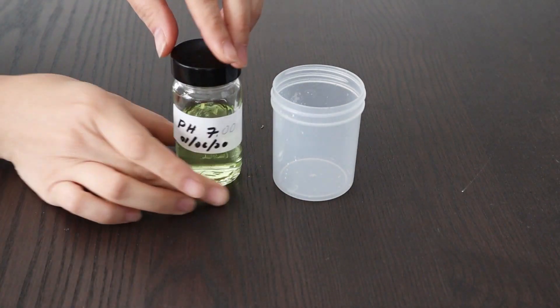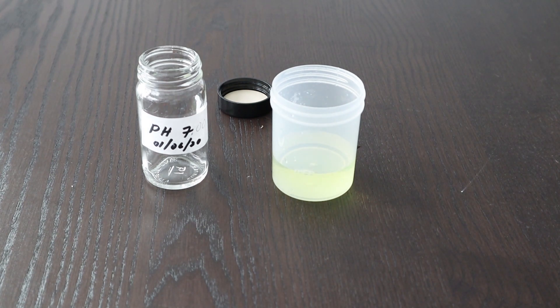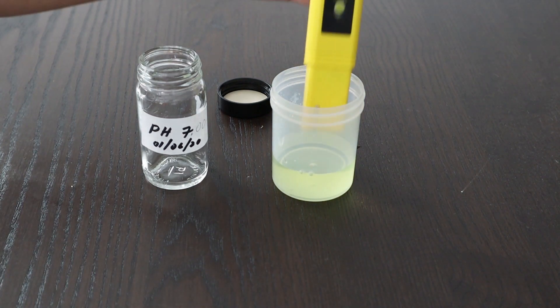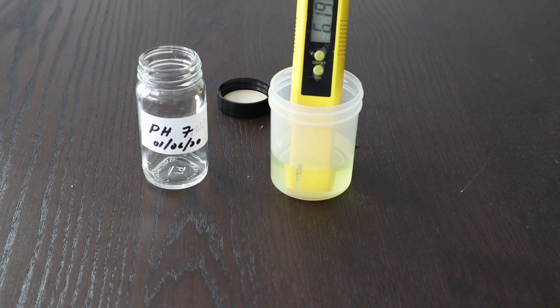To see how far my pH meter has drifted, I have a pre-made pH standard solution at pH 7, so if I put the meter in this solution, it should read 7. If not, then it definitely needs calibration. I put the meter in and it looks like it's going to read 6.2 — this meter definitely needs to be calibrated.